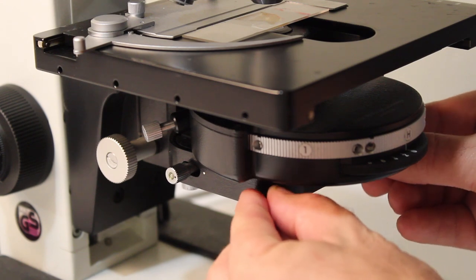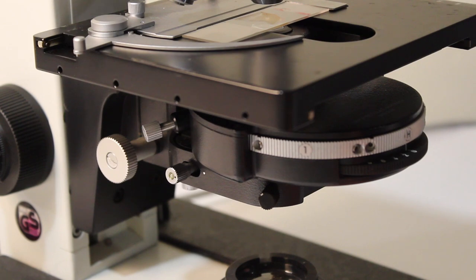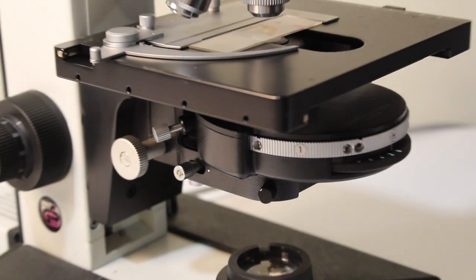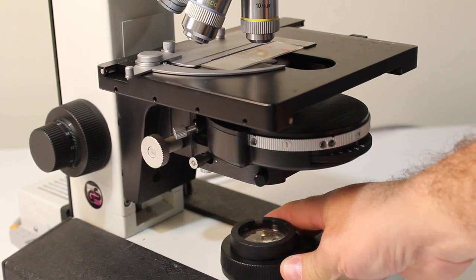This is a critical part of microscopy and determines the quality and contrast in your images. This process should be performed before every microscopy session to ensure you always get the best quality results that your microscope is capable of.